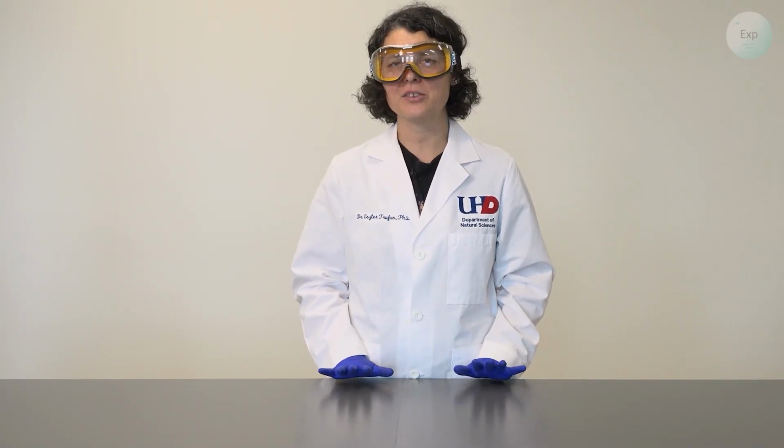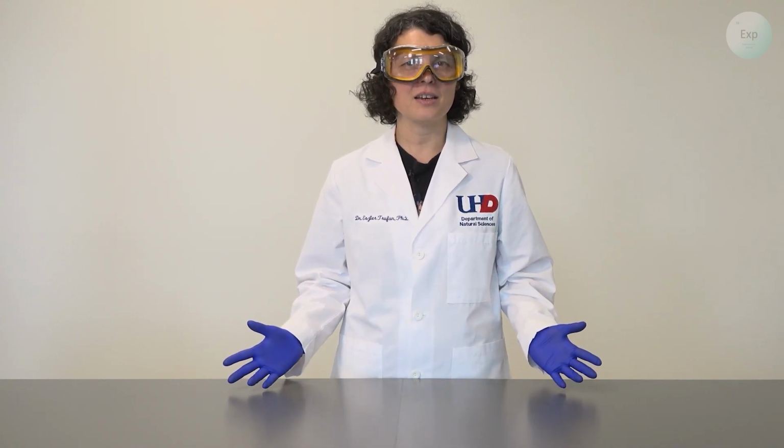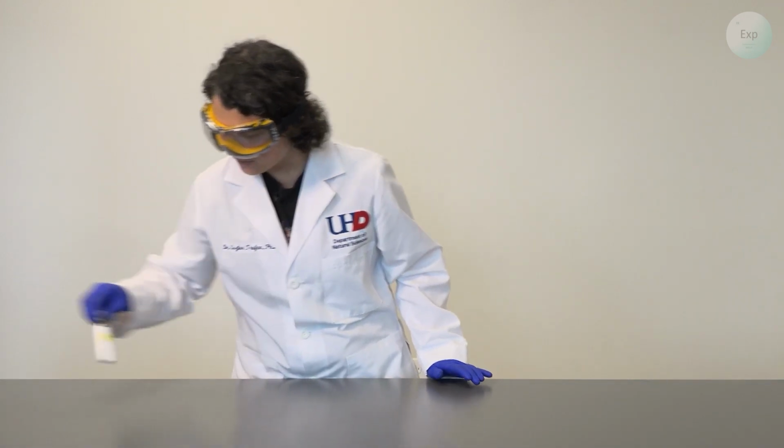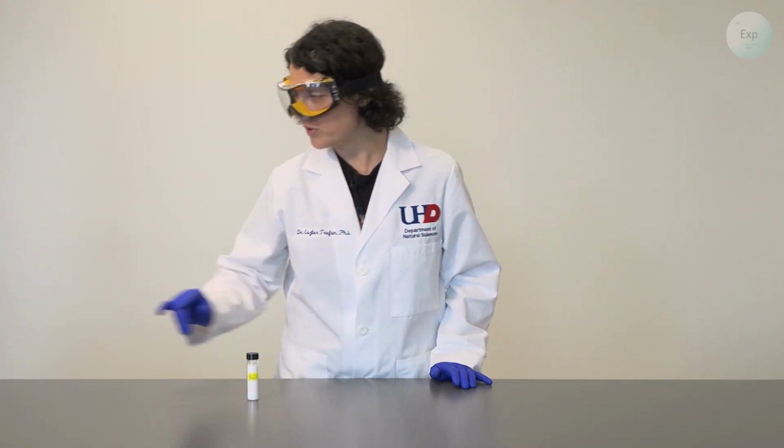In this video, we're going to make a saturated sodium chloride solution and see if the chloride as a common ion will have any impact on the solubility of the sodium chloride. So let's get started. For the experiment, we're going to use some sodium chloride or table salt.